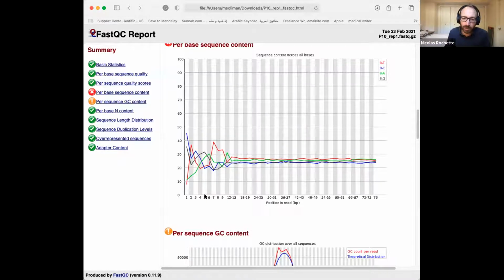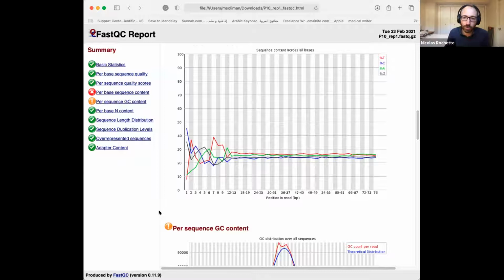But in some species, the GC content is very biased toward either AT or GC, and then the A and T or the G and C can be different. But what we don't expect is that the A and the T would stabilize at different levels, or that the G and the C would stabilize at different levels.